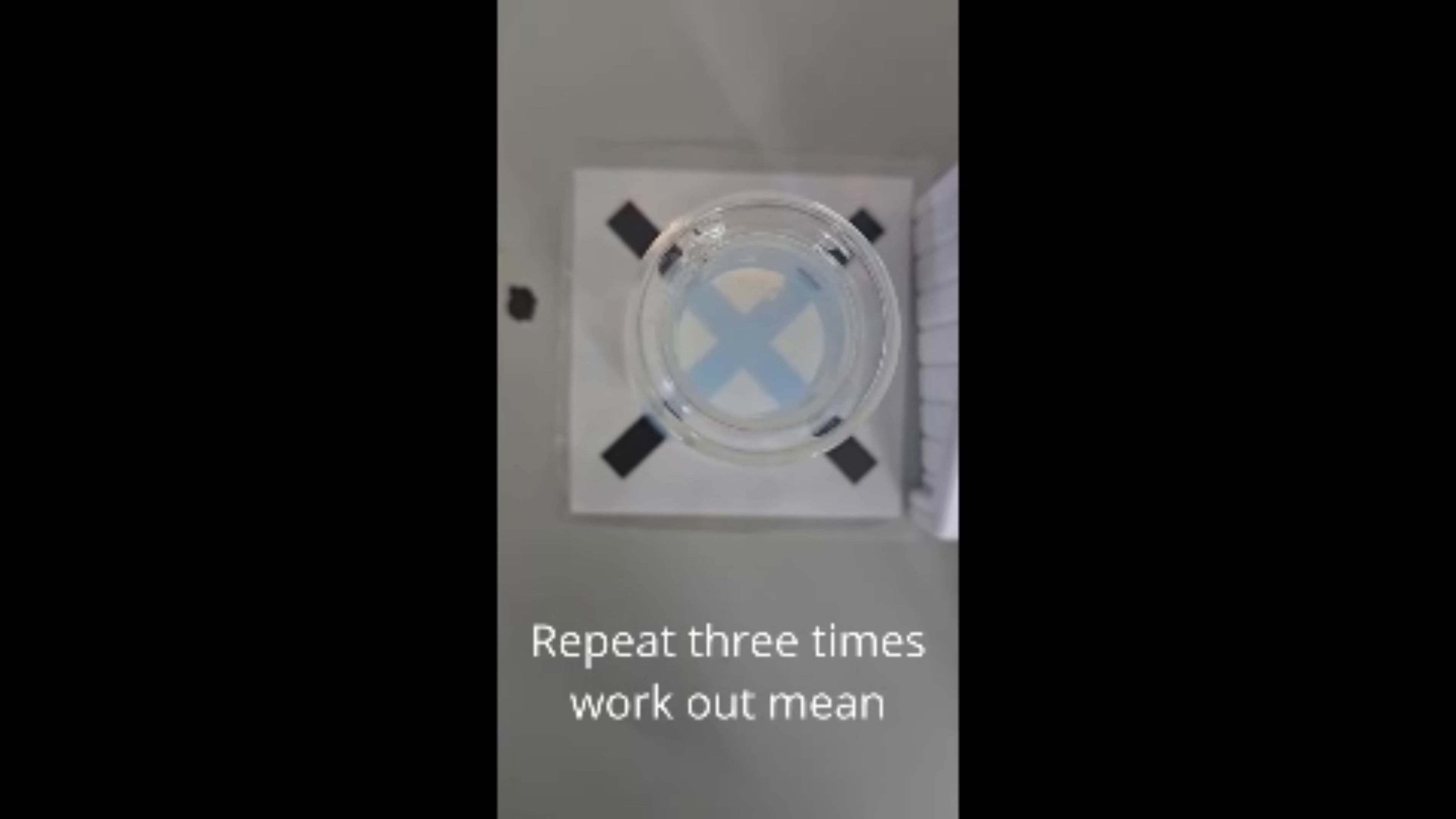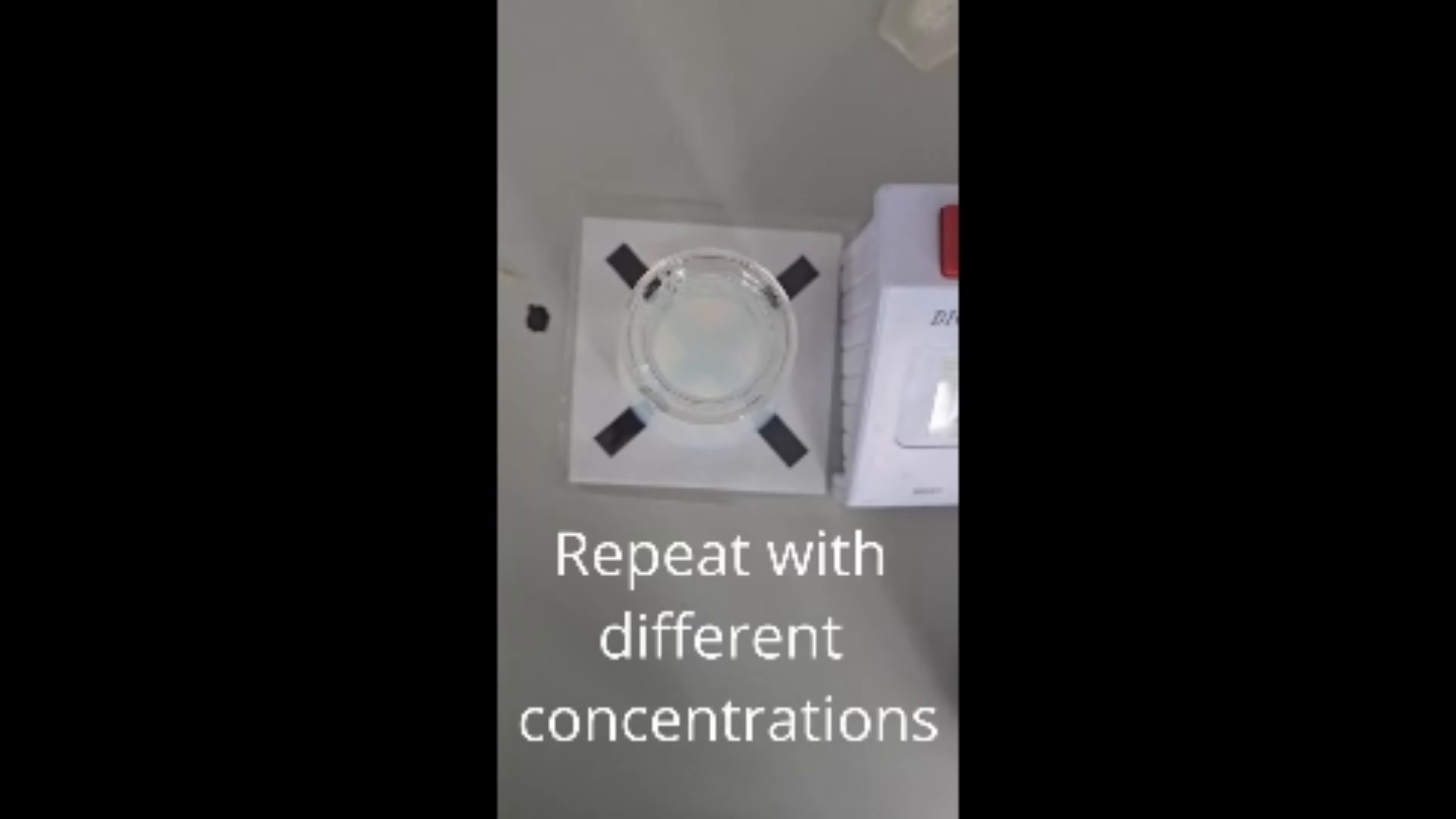You must record this time. Once you've done this, repeat it three times and record your results, calculating an average. Then repeat the experiment with different concentrations using the recipe sheet.